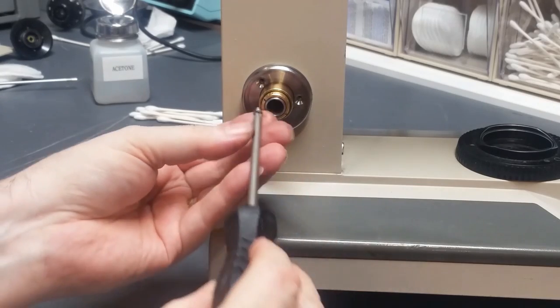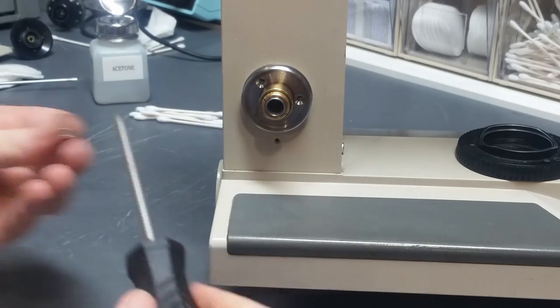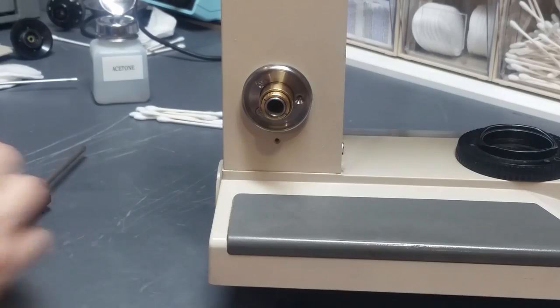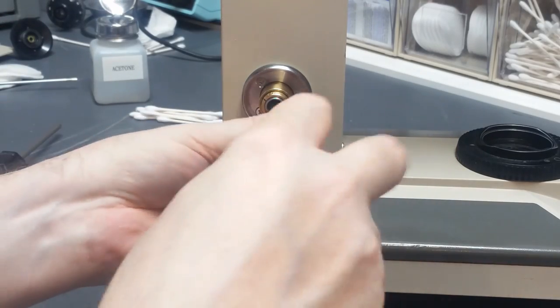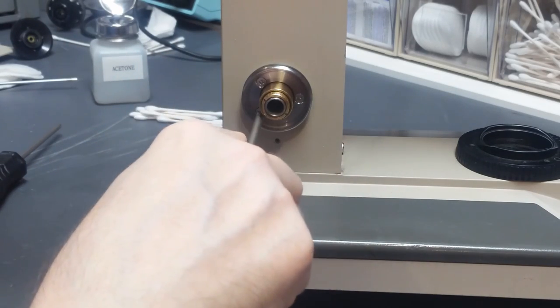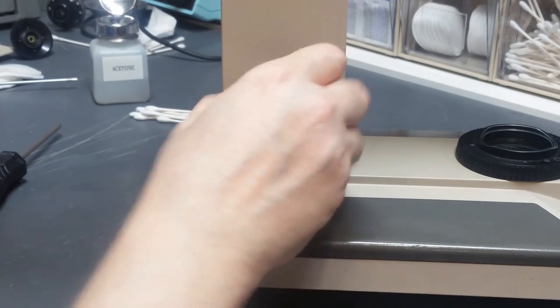So I'm going to put these three screws in. These are, of course, countersunk flathead screws. And switch out and use the proper screwdriver to actually snug these babies down, because you've heard my preaching on screwdrivers. Okay, that piece is in.